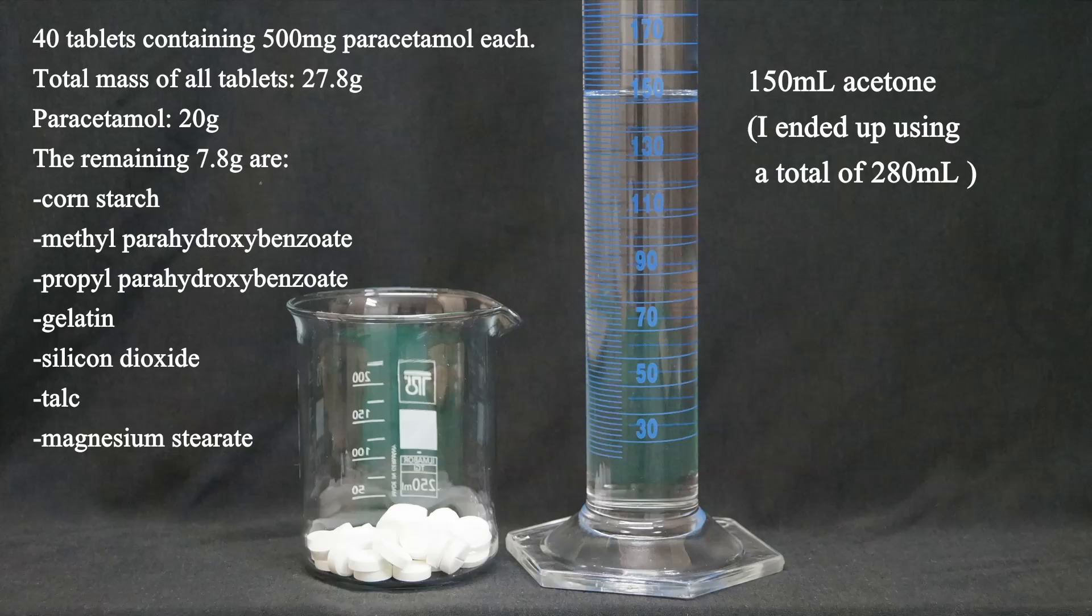This looks dodgy, doesn't it? And I know, you must be wondering if I have a cousin from France. But no, the pills on the left are a generic brand of paracetamol that I got from friends and family. They are past their expiration date but will be good enough for my purposes.